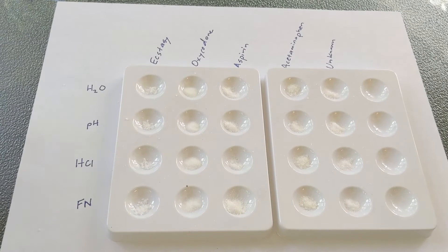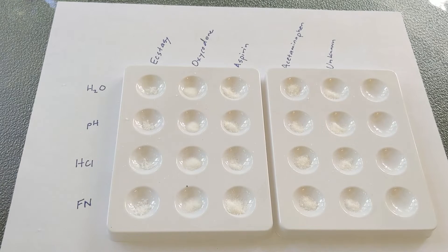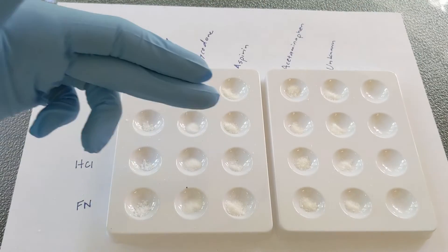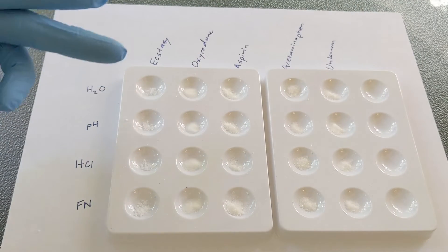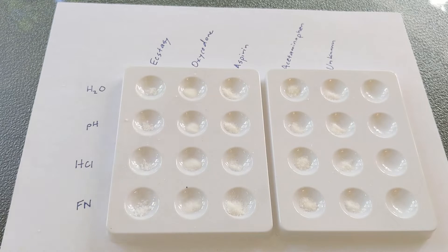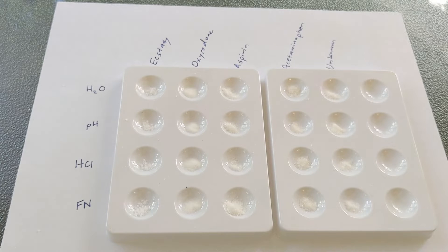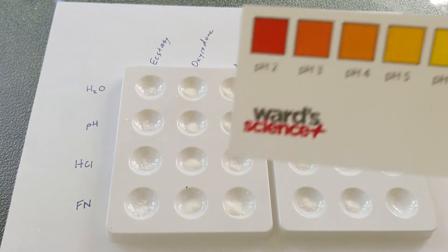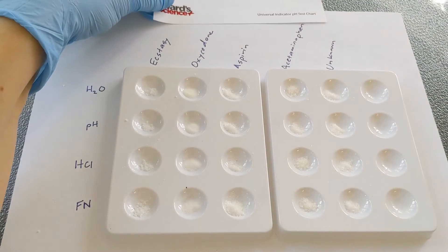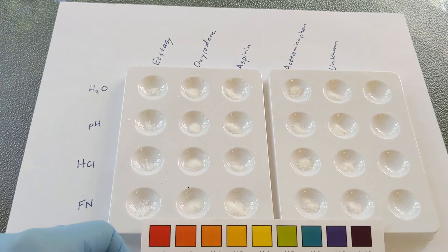If you're going to be doing this lab on your own, you want to stop here so that you don't see the results. You will simply add one to two drops of each of your liquids to the correct row and look for signs of a chemical change. If you're not able to run this lab in person, however, you can watch and then just interpret the results.